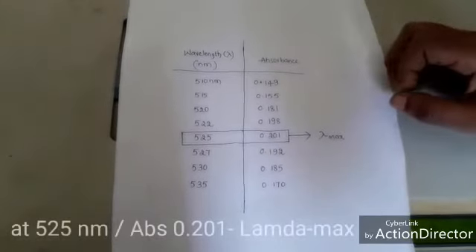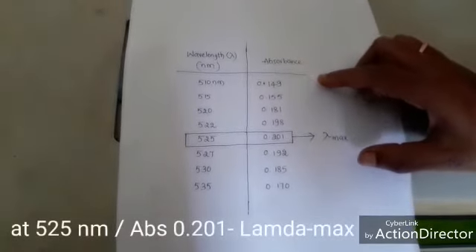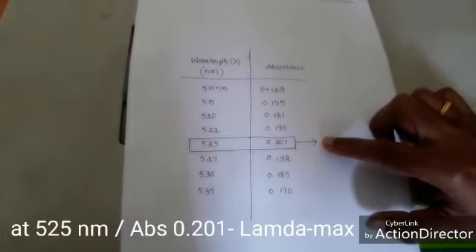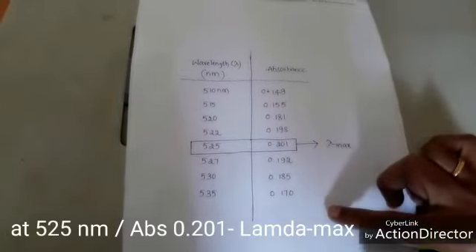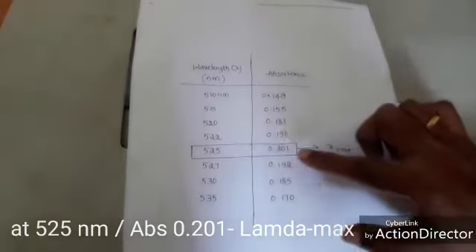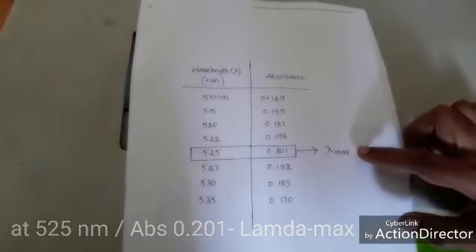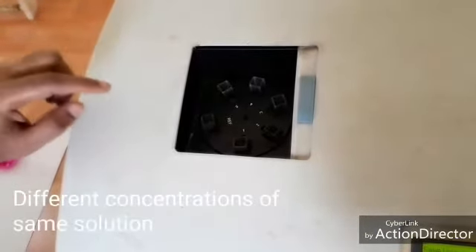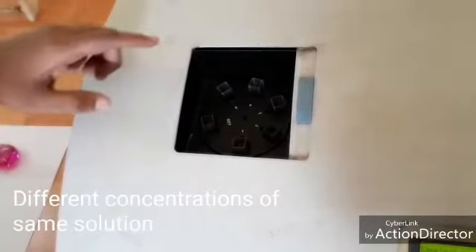See here, absorbance values increase up to 525, then absorbance values decrease. So 525 is lambda max. Here we kept a series of different concentrations.